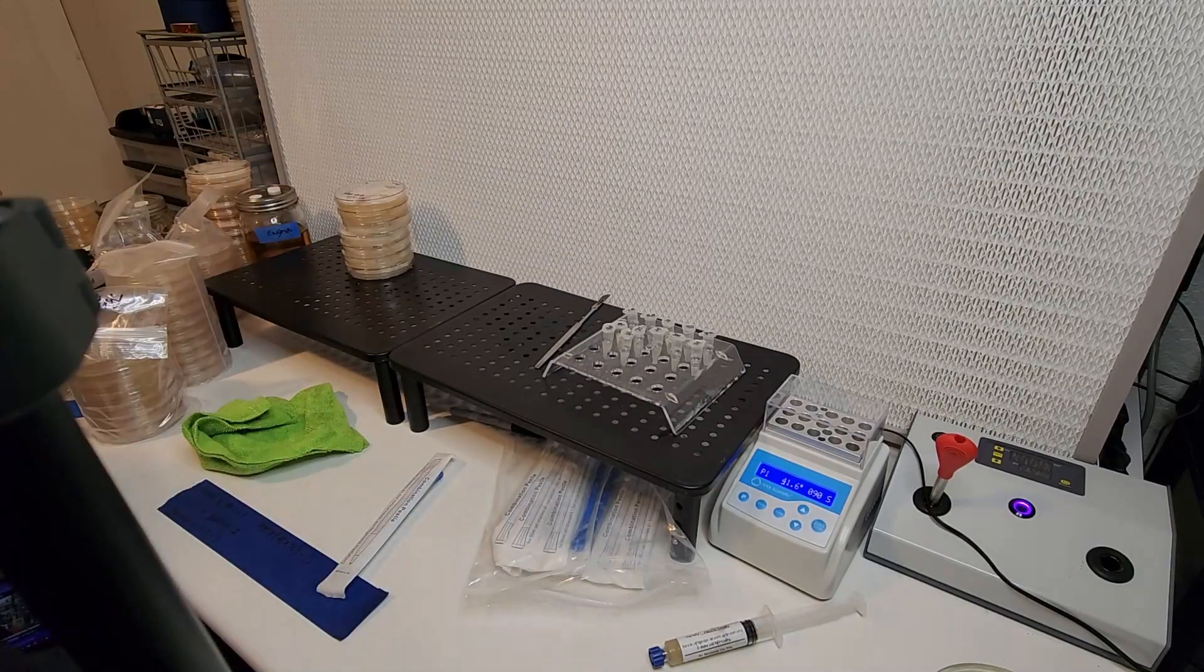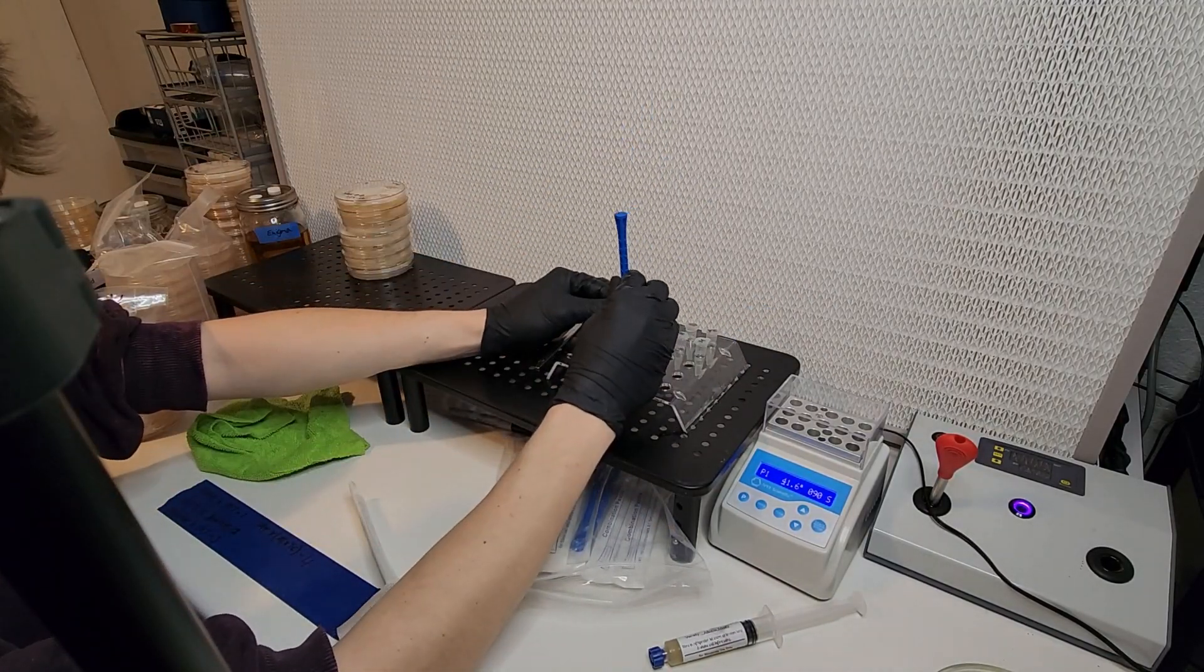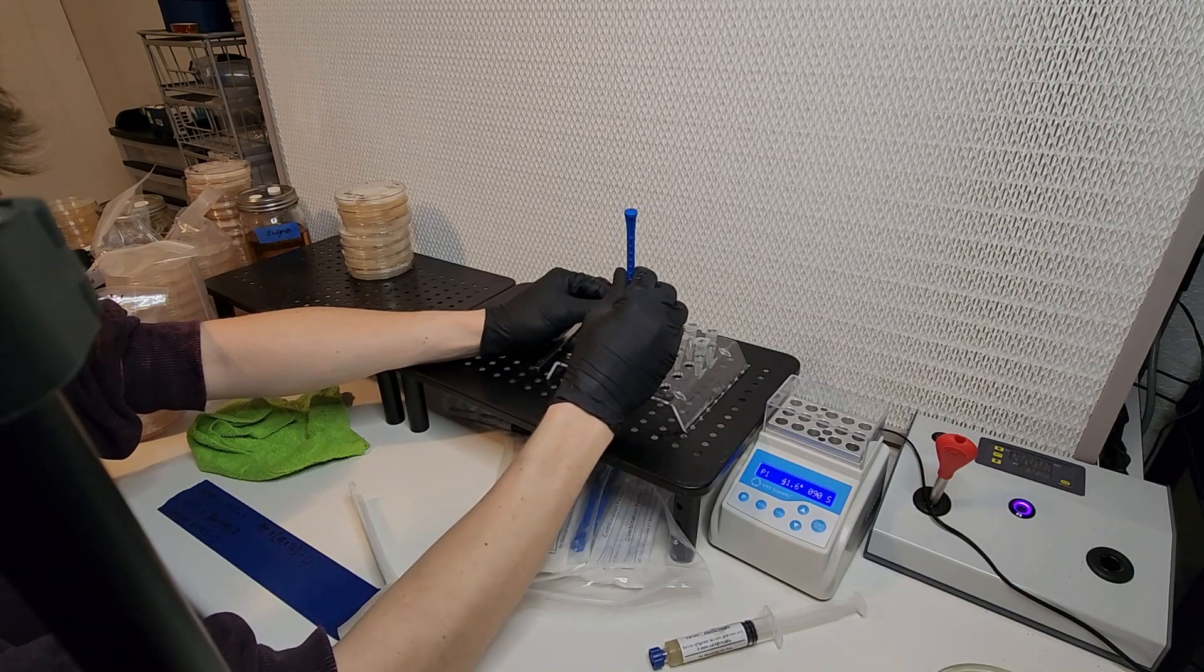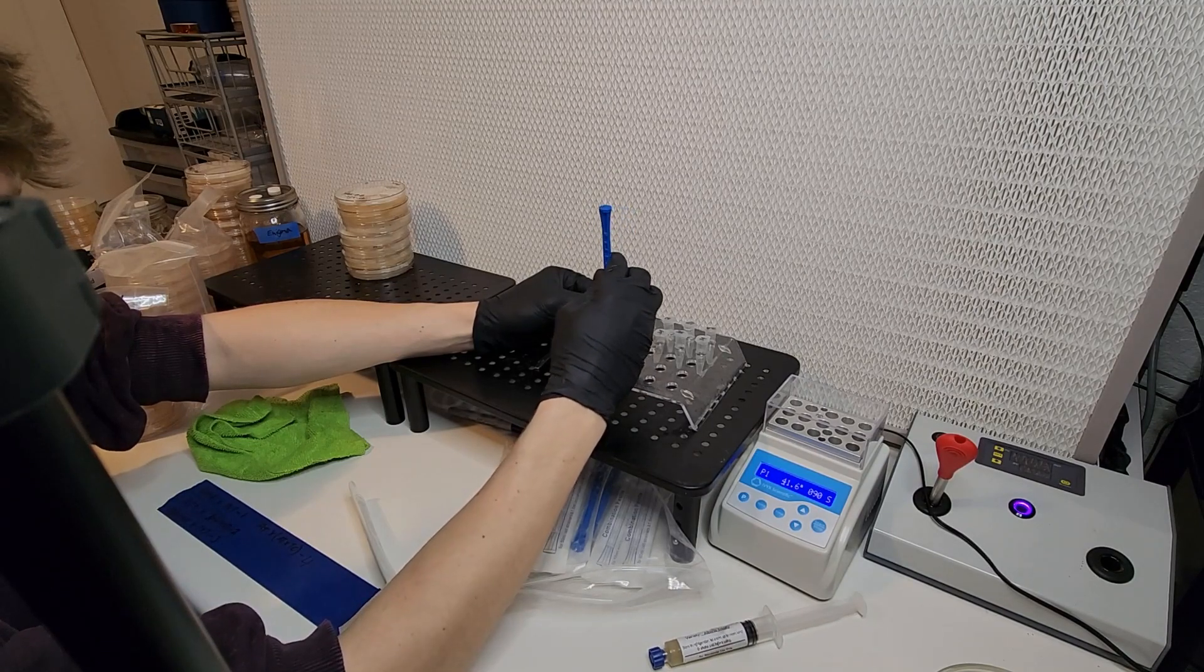And here you see that I'm doing the pestle phase, a phase which I could have accomplished before putting the liquids in and I think would have been a little less of a hassle.